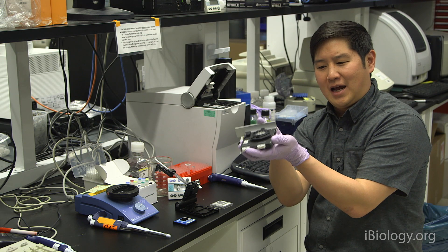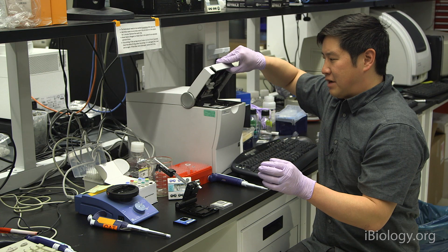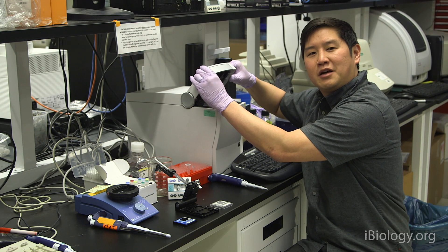If you need to store this electrode array, store it upside down so that these electrodes don't get damaged by bumping up against surfaces. To put the electrode back into the system, simply slide it back down and allow it to go down on its own. Don't force it in. Once it's dropped to the lowest position, lift the lever up, and this will pull the electrode array in.